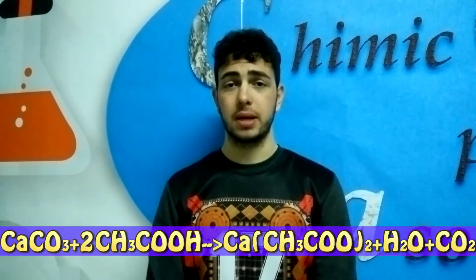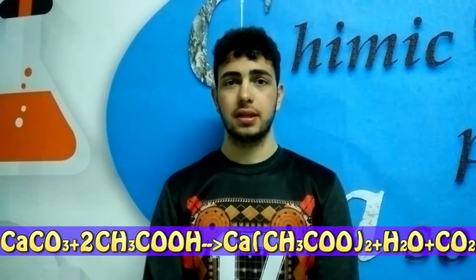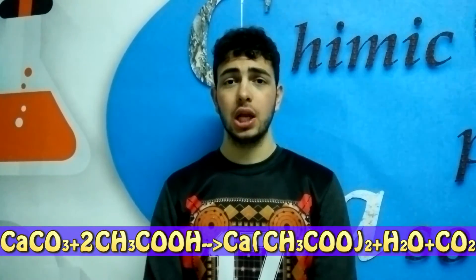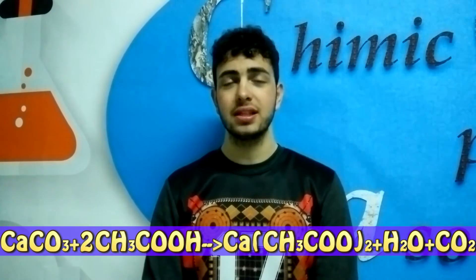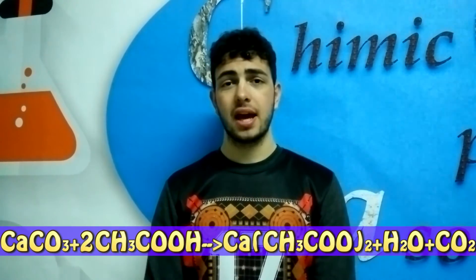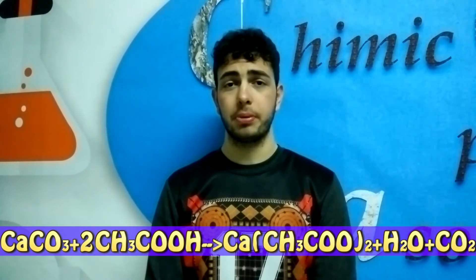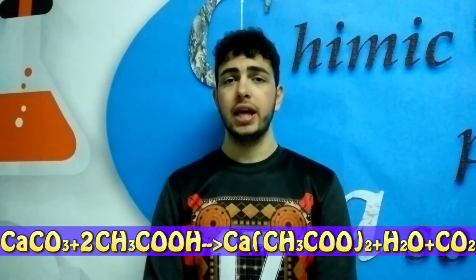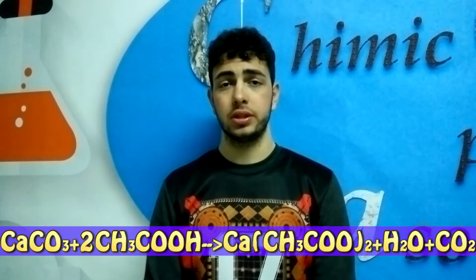What we can see from this reaction is that our reagents — acetic acid and calcium carbonate — react in a reaction that allows an exchange of ions. In fact, what is produced from this reaction is our final product, calcium acetate, and also carbon dioxide and water.